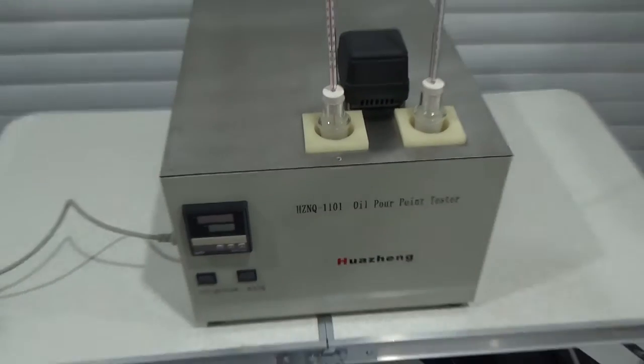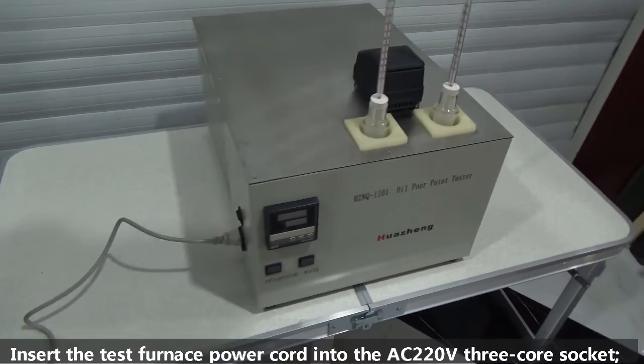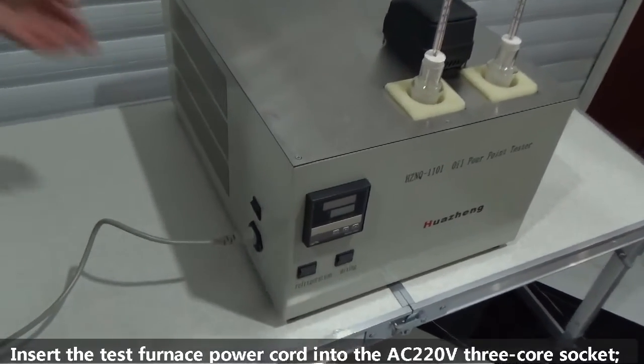Then open it again and add the water. It will be checked.